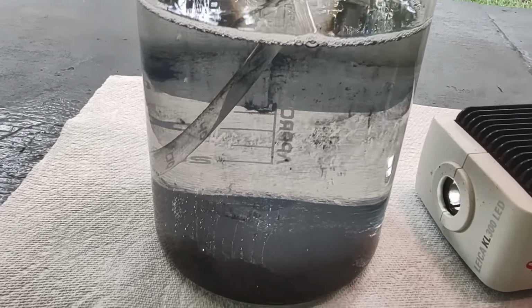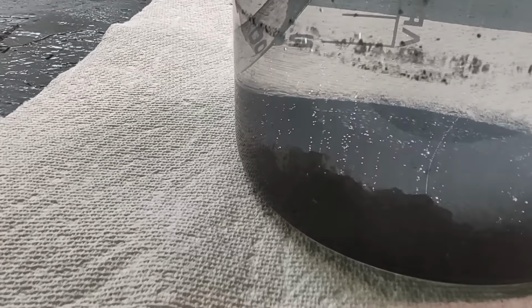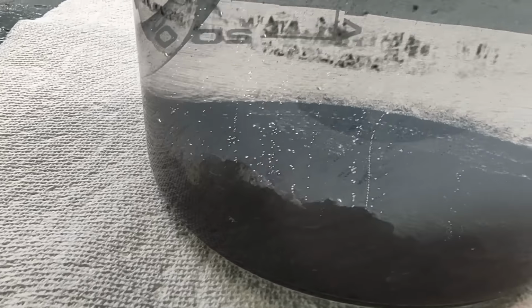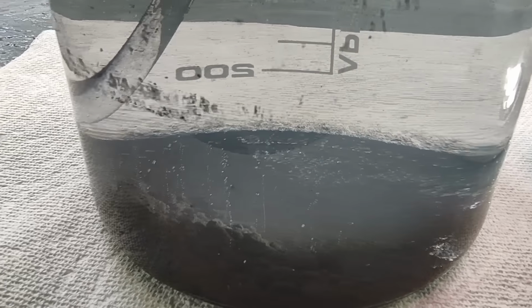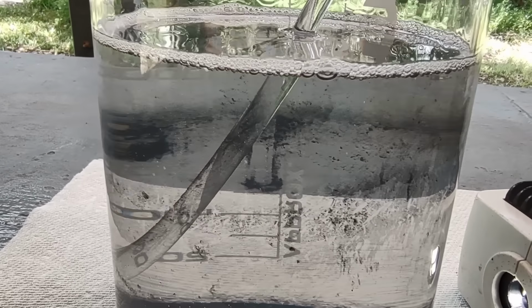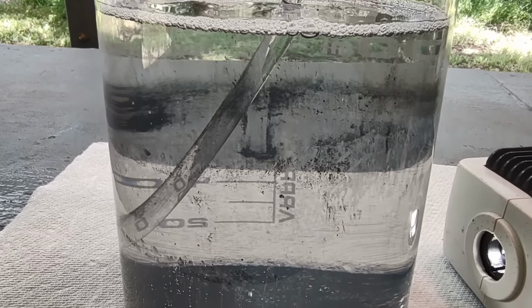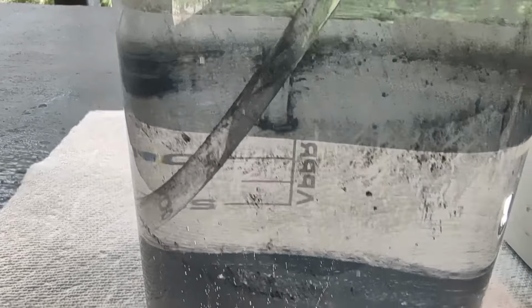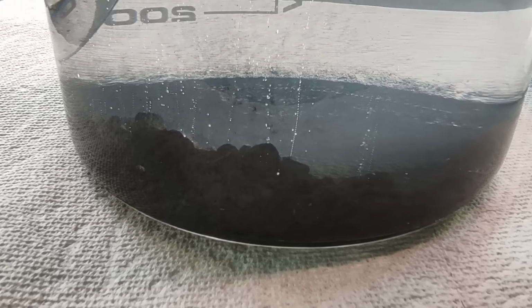Well, will you look at that? Yeah, the liquid cleared right up. There is quite the pile of palladium down here on the bottom of the beaker. I'm really surprised at how clear the liquid is. I'm expecting it to be a little bit green still from copper and nickel contamination, but I don't know. Maybe this palladium was cleaner than I thought.